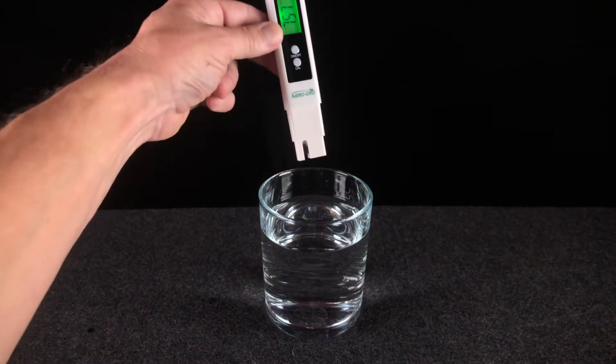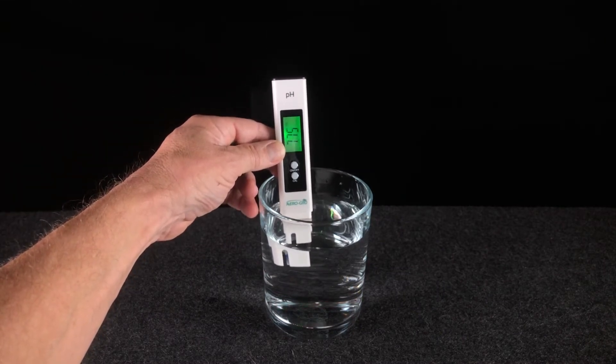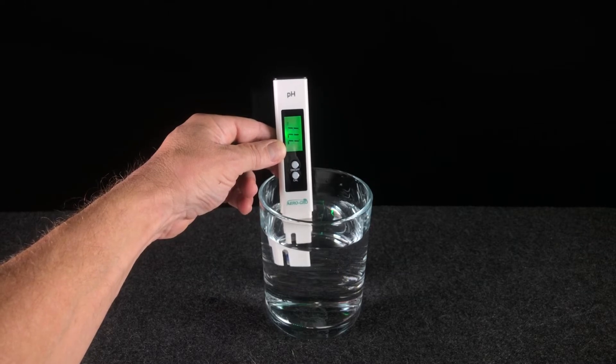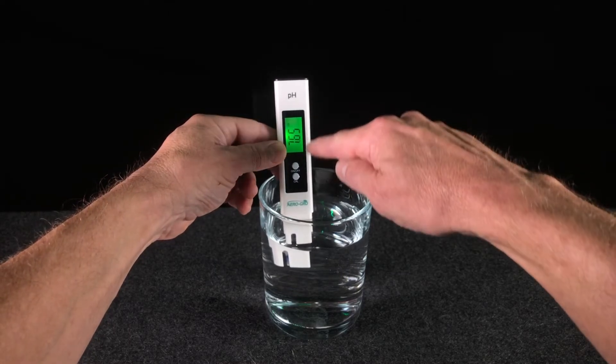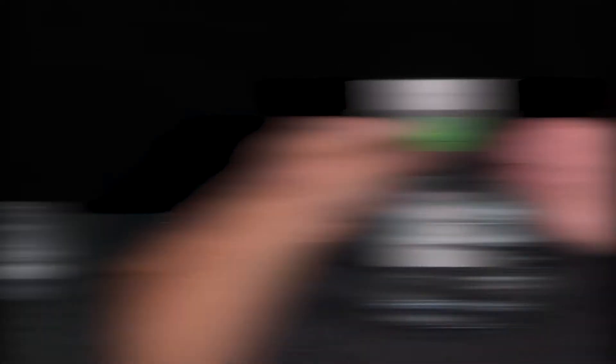Now to take a reading, simply dip it into the solution and wait for about four or five seconds, and then take your reading. It's as simple as that. Remember, there will continue to be a bit of drift. That's normal, but after four or five seconds, take your reading, you're done.